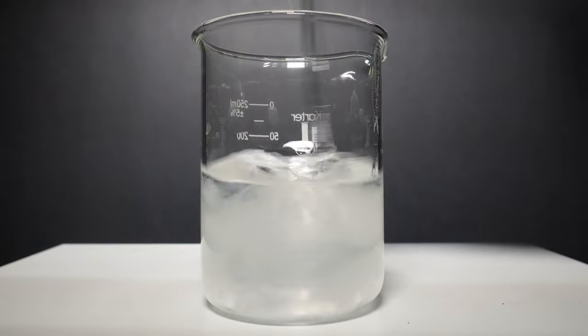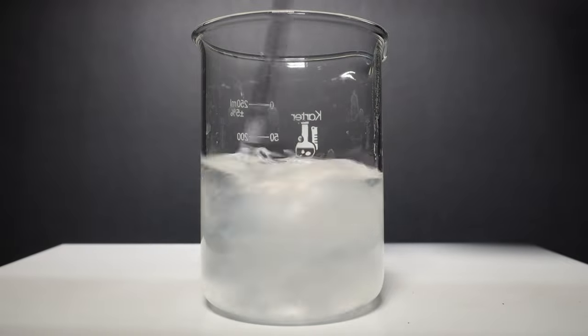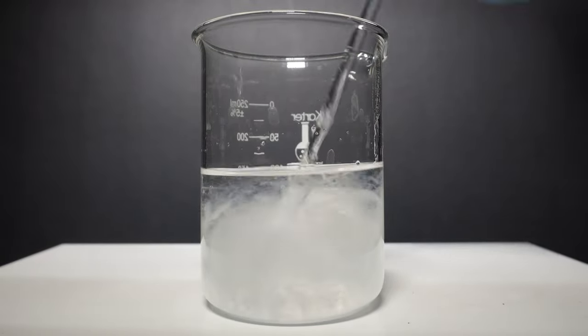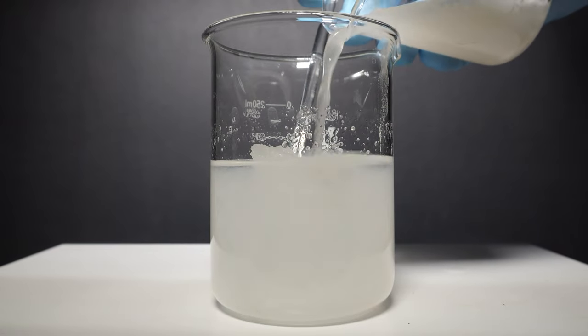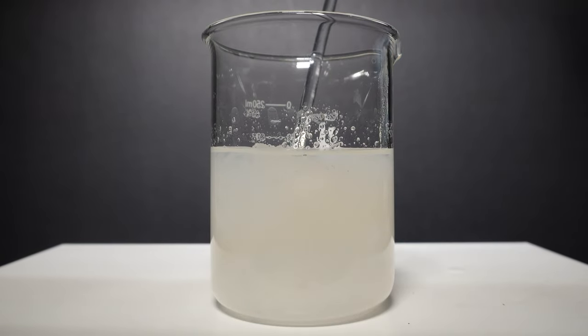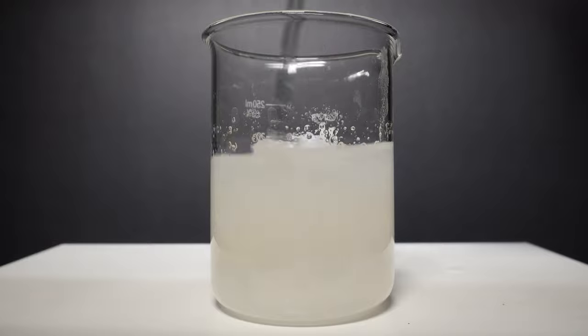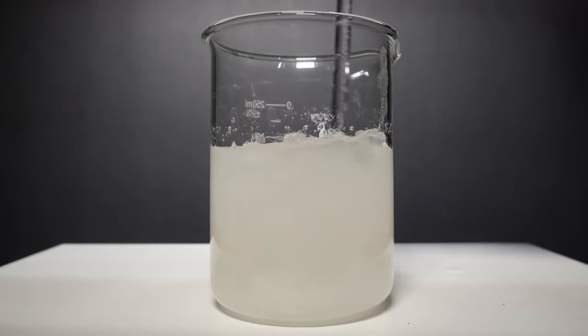Add in the calcium acetate and stir after every addition. This will give you complete control about the consistency of the jelly you want to make. After 3 additions the jelly will start to take over the liquid and we can see nice chunks start to form.